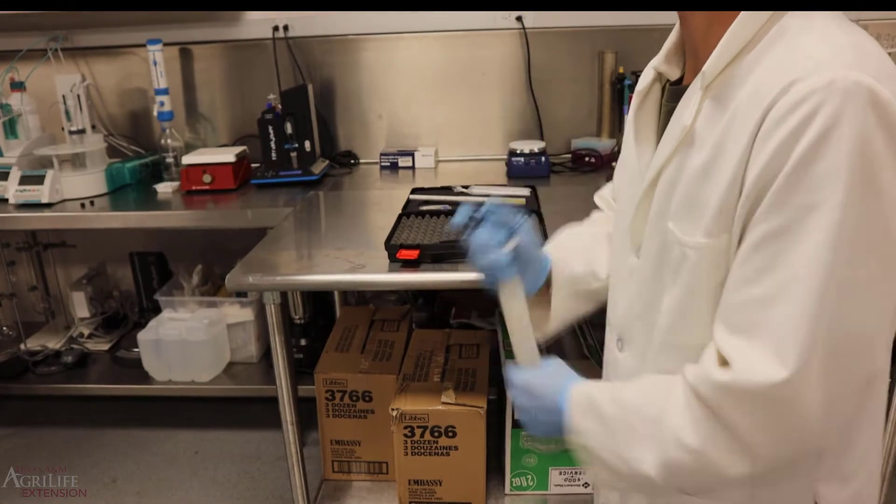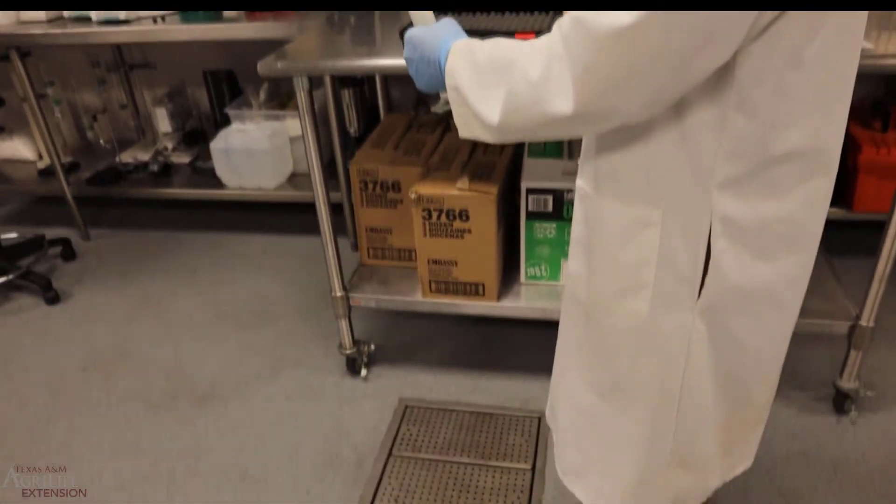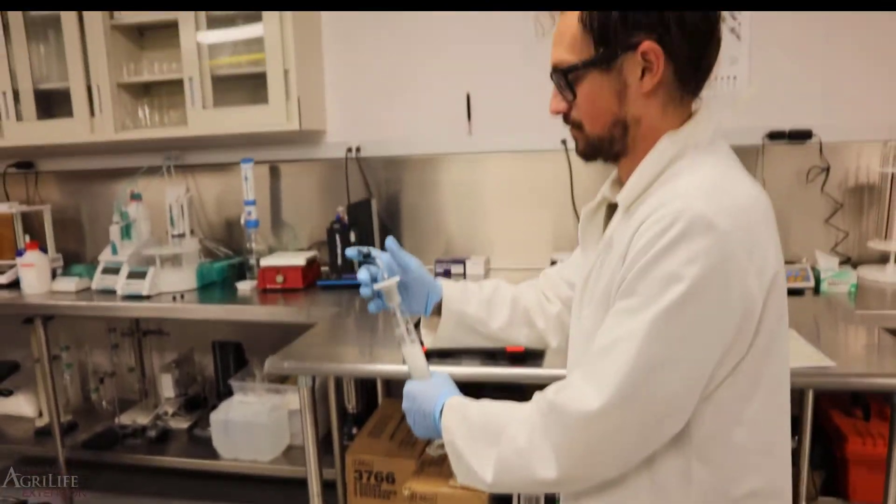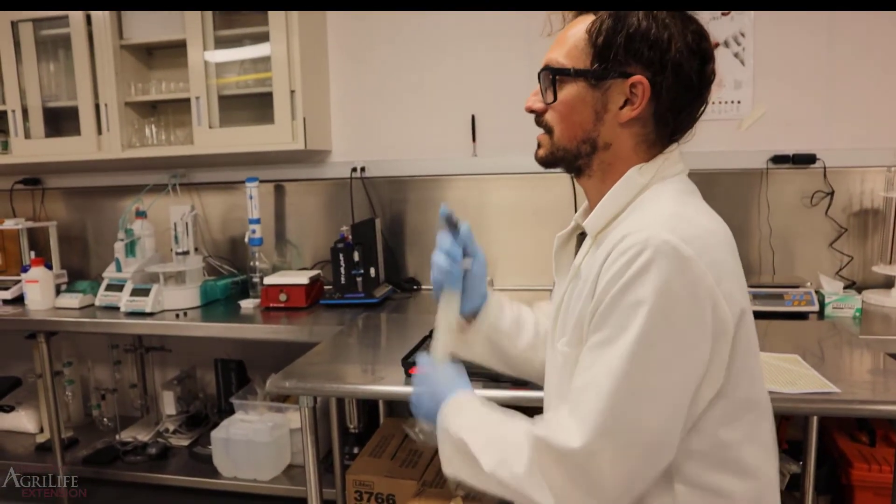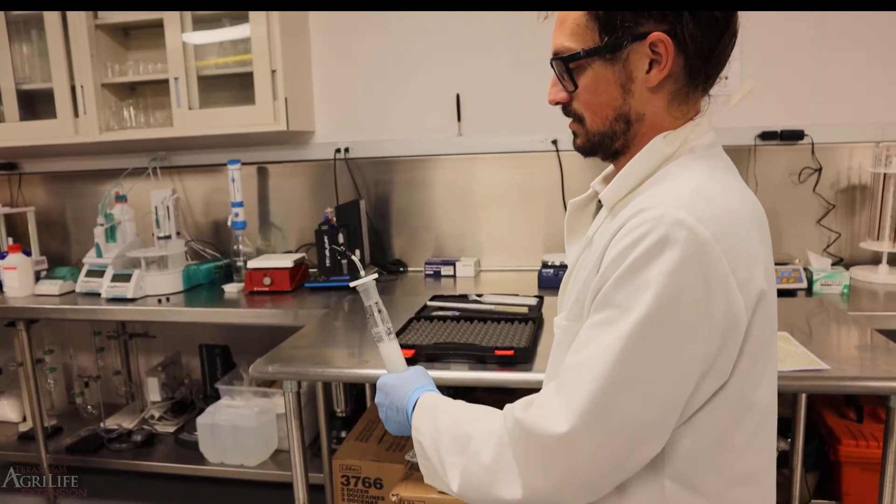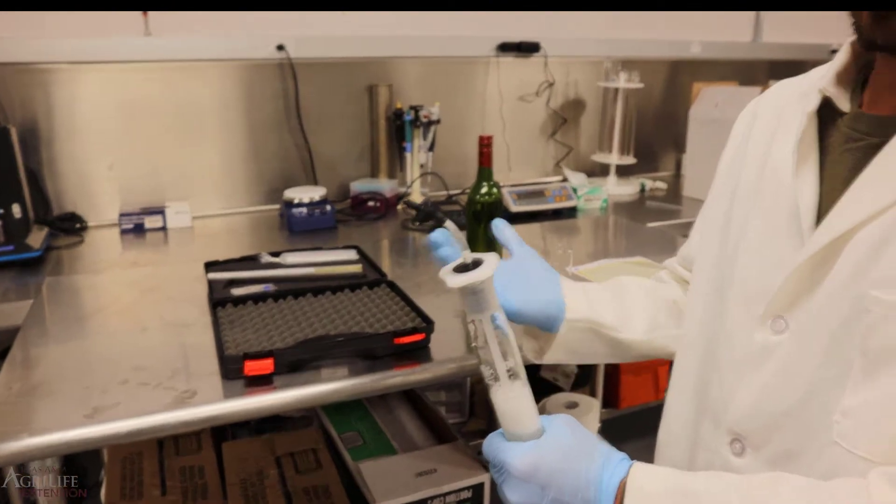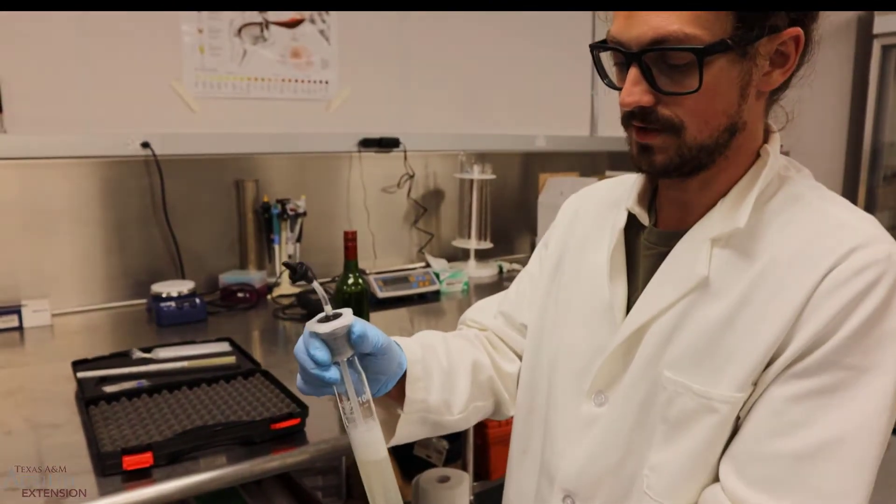This test is a little messy when doing it at your winery. Be sure to do it over a sink or out in a cellar or somewhere where it's easy clean up. And as we see, no more wine is coming out after that. So now we will go over and take our measurement.